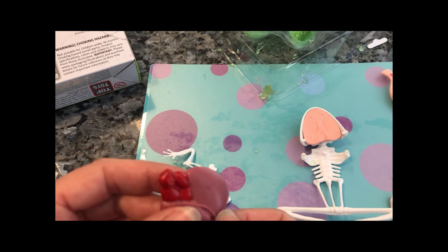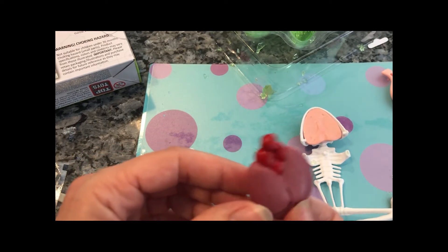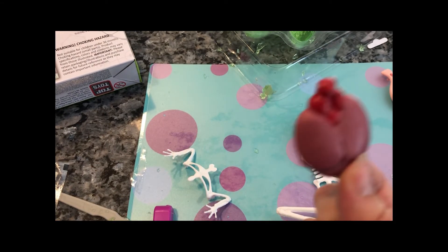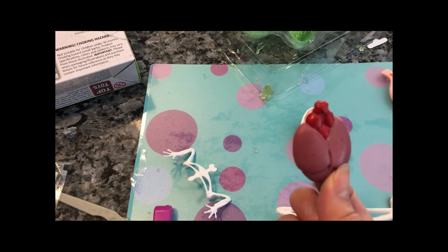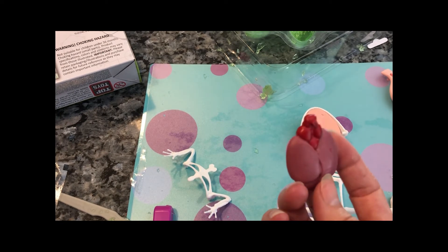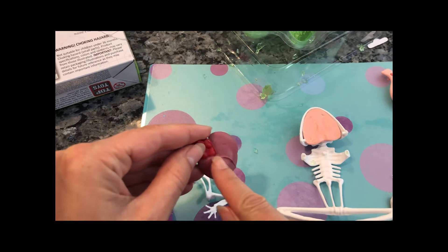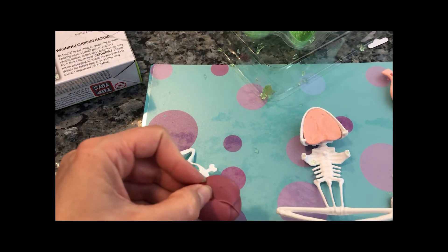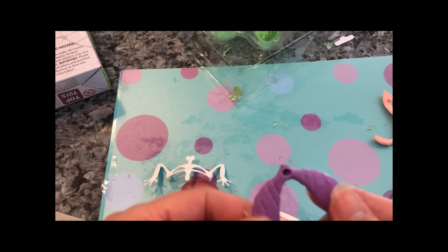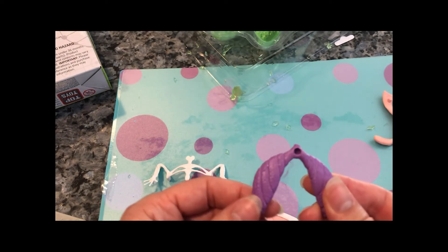You remember when you can hear mommy's heart? This is what the frog's heart looks like. Is that what our heart looks like? Yes — it's very similar. When frogs breathe, just like humans, we inhale oxygen in the air. We take oxygen in through our lungs, and we exhale carbon dioxide back out into the atmosphere.